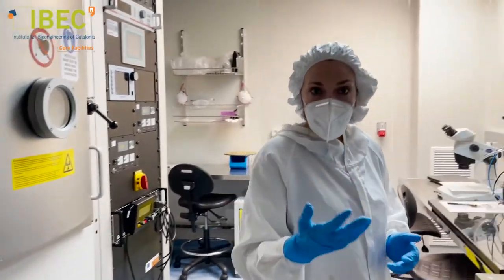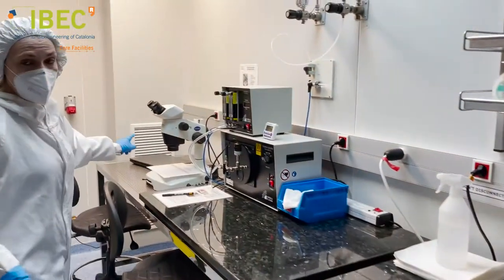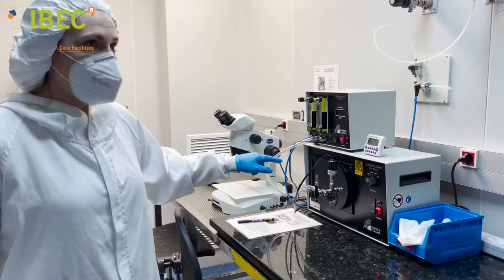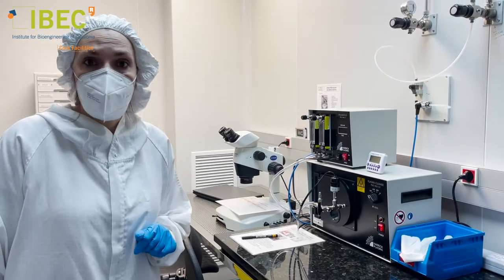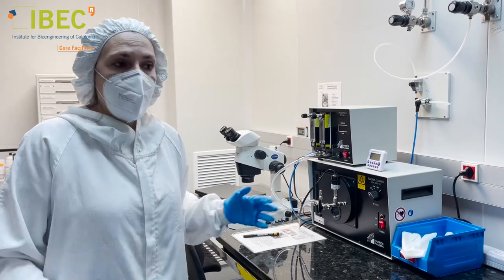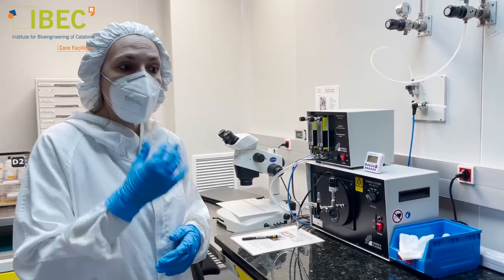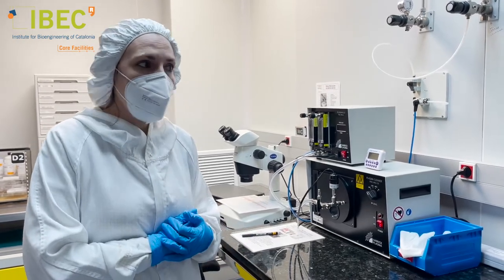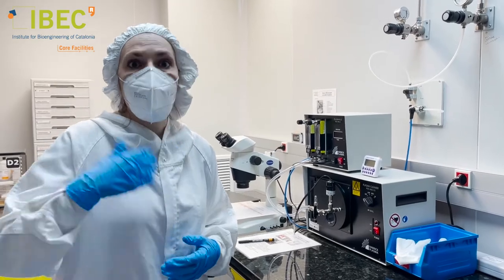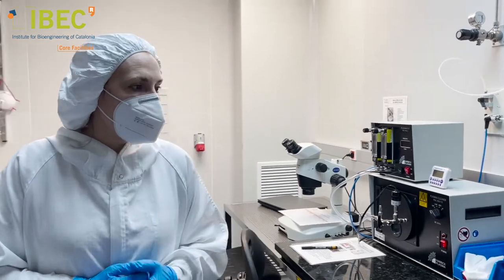We have side equipment like an oven, hot plates, balances, and a stereoscope. We also have another important instrument: this plasma generator. In particular, this one works with oxygen, and the oxygen plasma is very useful to eliminate organic contaminants from our substrates but also to activate the substrates for further processes done here in our space.